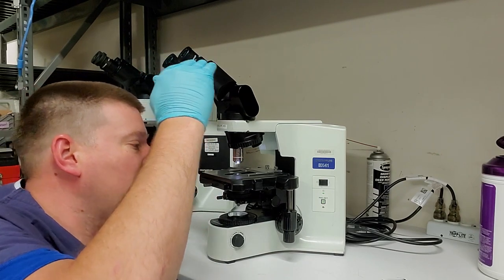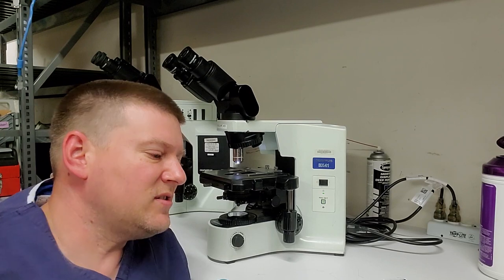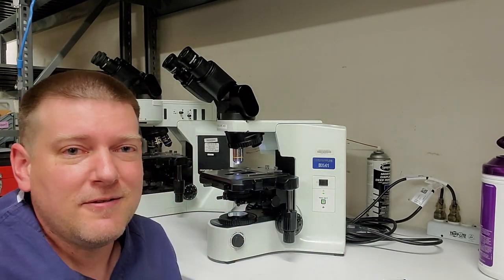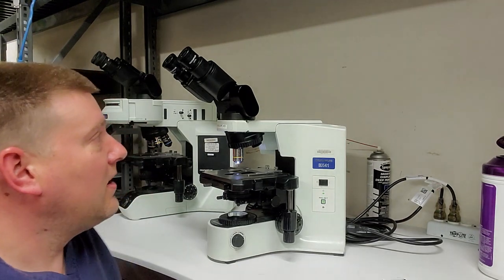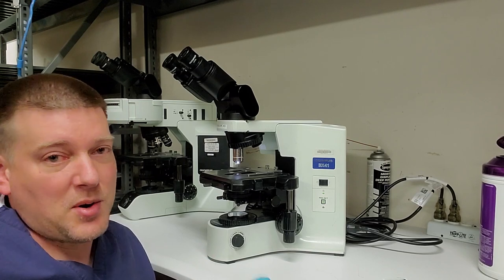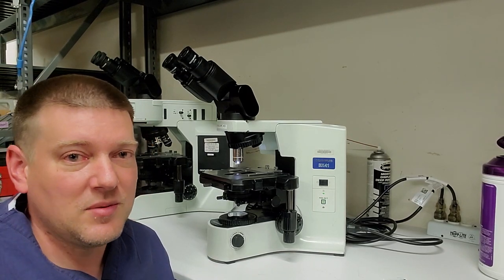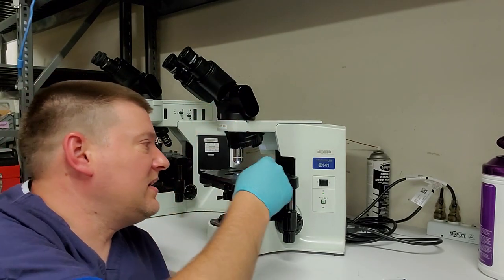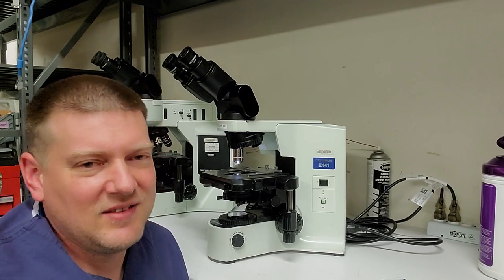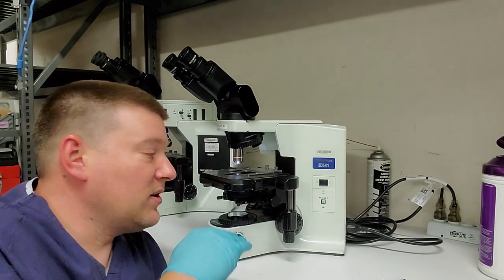You're going to start at the top, work your way down to the bottom. Don't clean any surfaces that you don't have to. Now, I got these here on the table just in case I need it for something. I didn't need it this time. This one was clean. Don't fix something until it's broke, guys, because once you contaminate a microscope, some of those hard to reach optics like up and in here or up and inside your turret head, it's such a pain to get those clean. Okay, so just clean the surfaces that you can easily access.